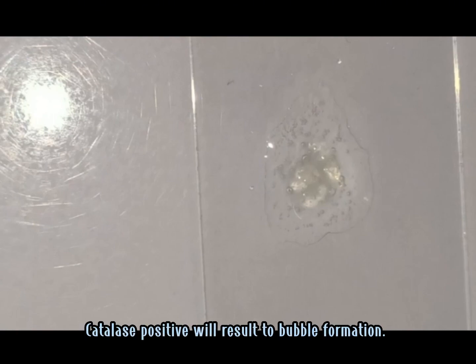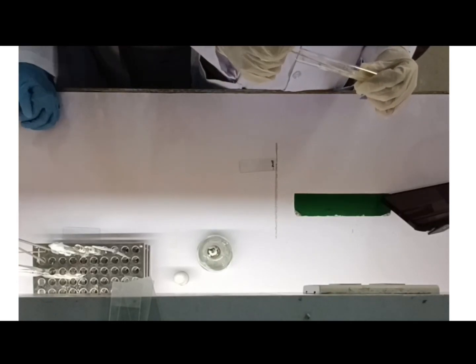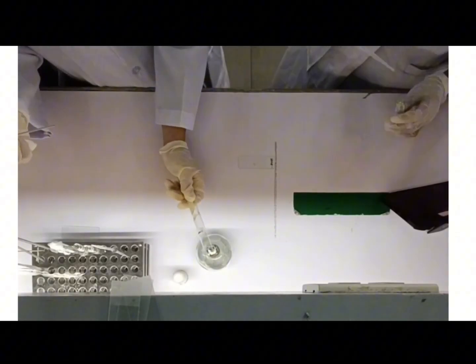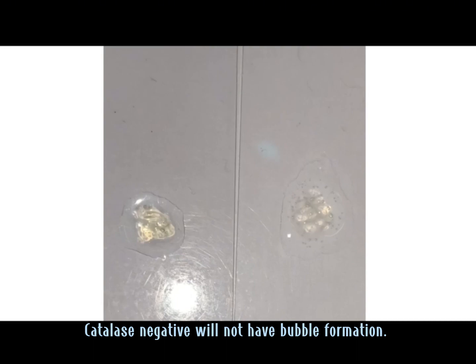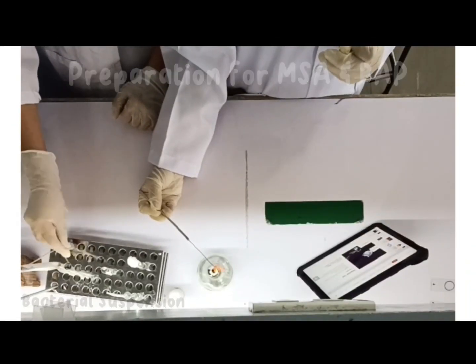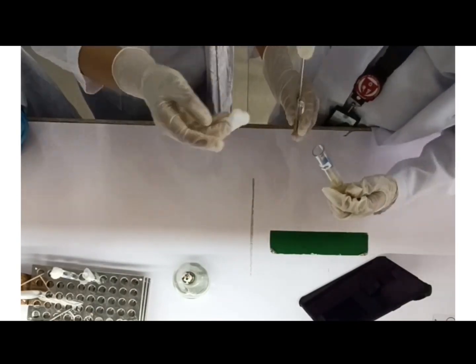Since we can see here a bubble formation, we can conclude that this is Staphylococcus aureus because it is catalase positive. The same process goes with Streptococcus. As we can see, there is no bubble formation, meaning it is catalase negative. Therefore, it is Streptococcus.